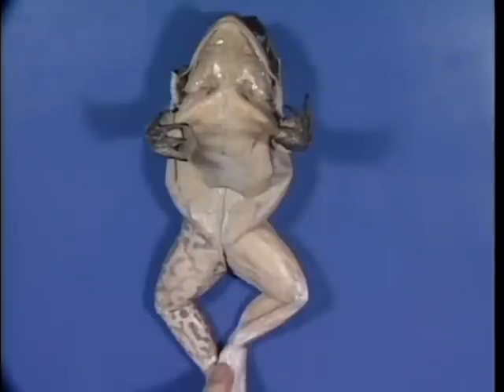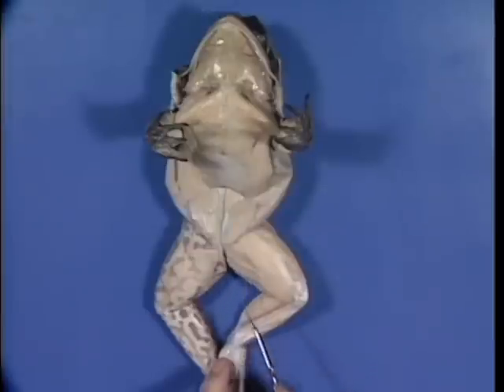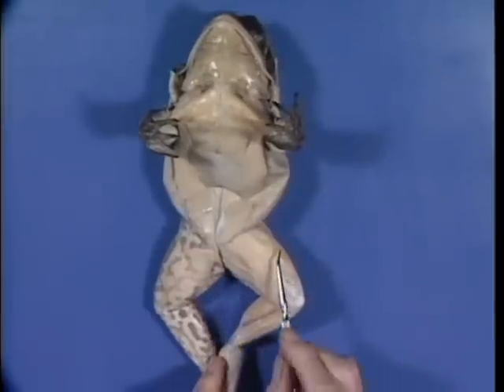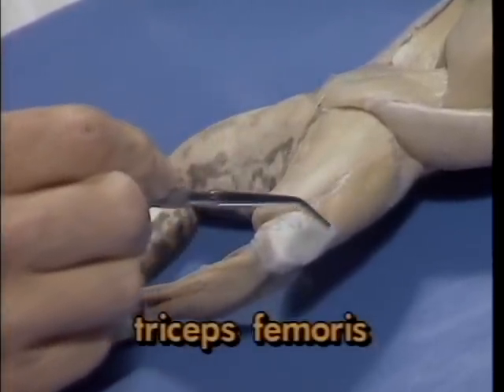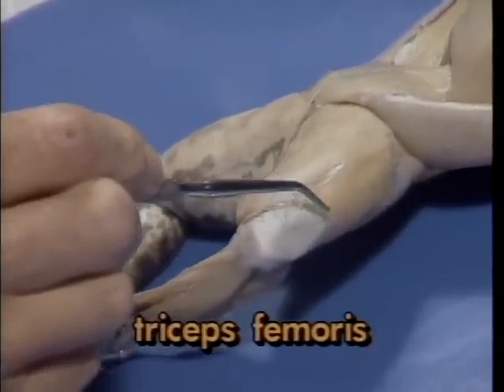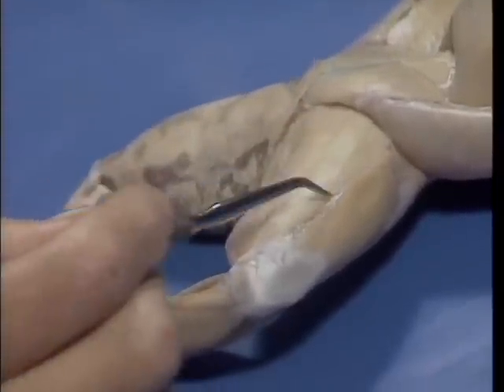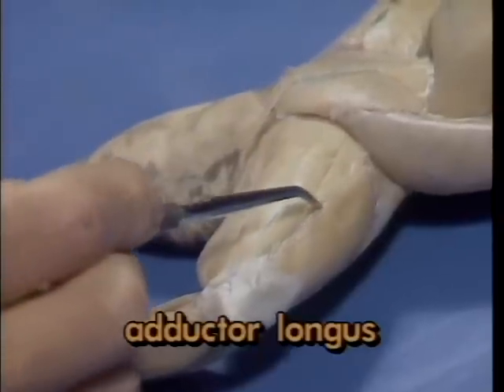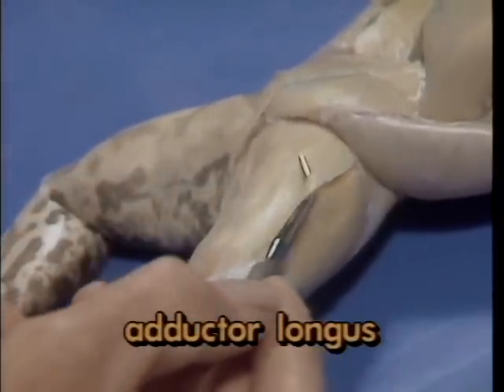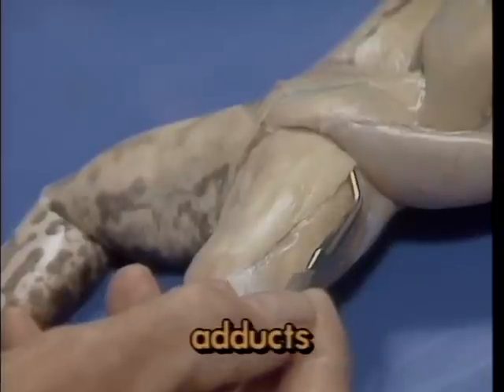First, let's examine the ventral ones, from lateral to medial. The muscle which occupies the anterior border of the thigh is called the triceps femoris. It can be seen from both the ventral and the dorsal surfaces. Medial to the triceps femoris is the adductor longus. Its action draws the limb toward the midline, or again, as the name implies, it adducts the hind limb.